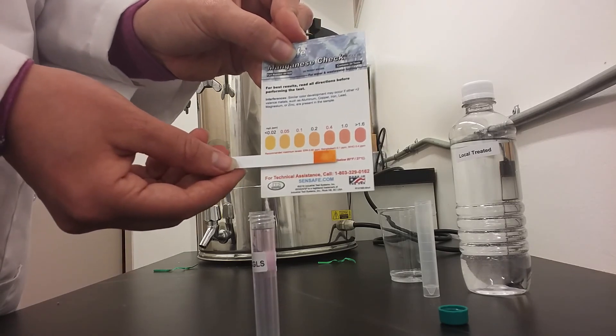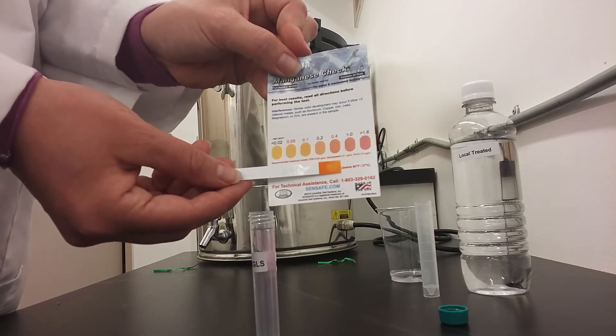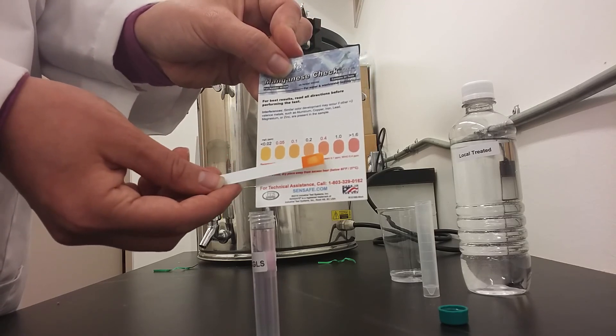If the colored dot does not match up exactly, feel free to write down a number in between the ones you feel match best.